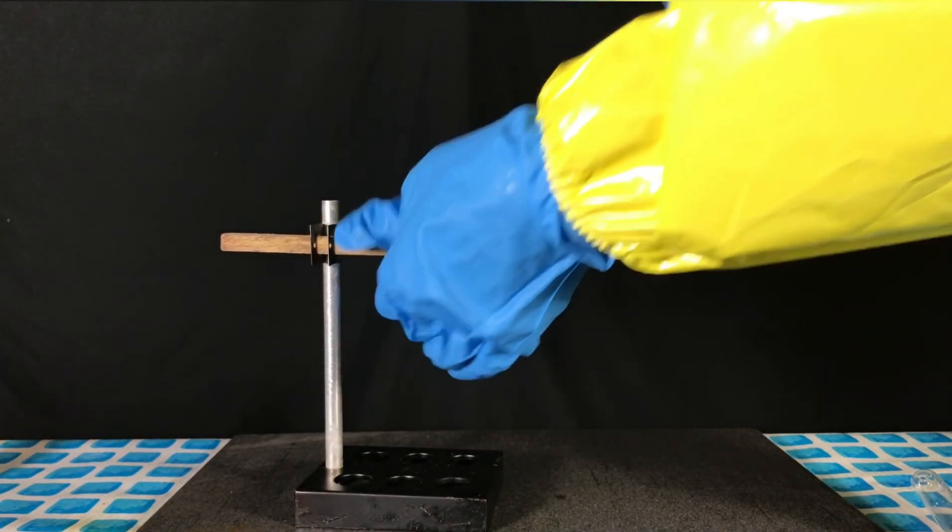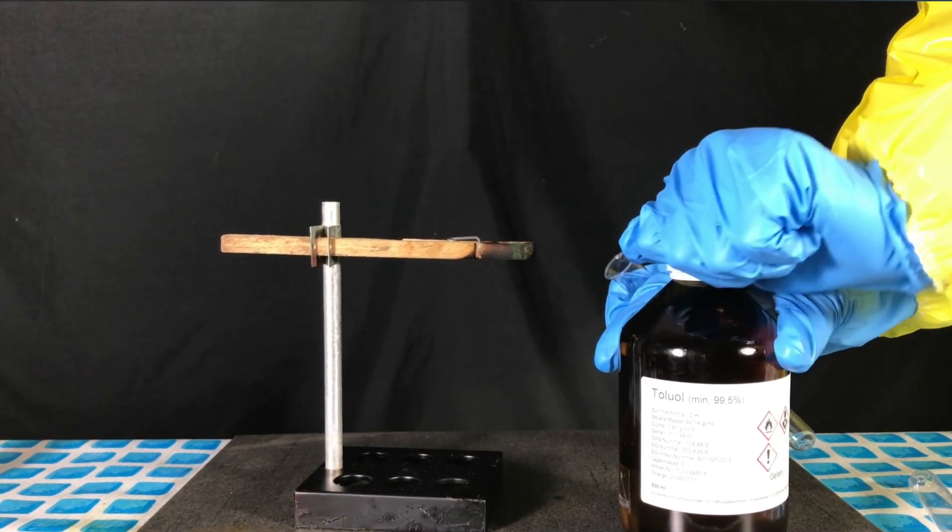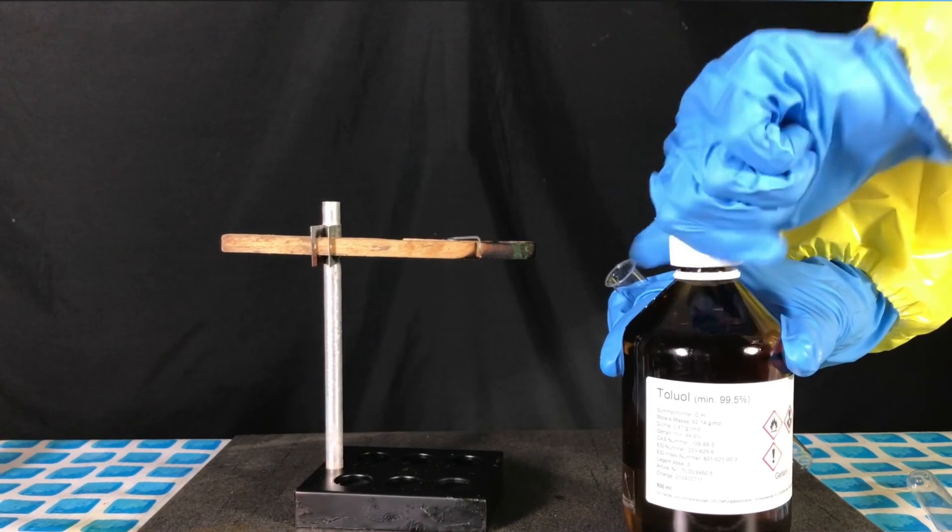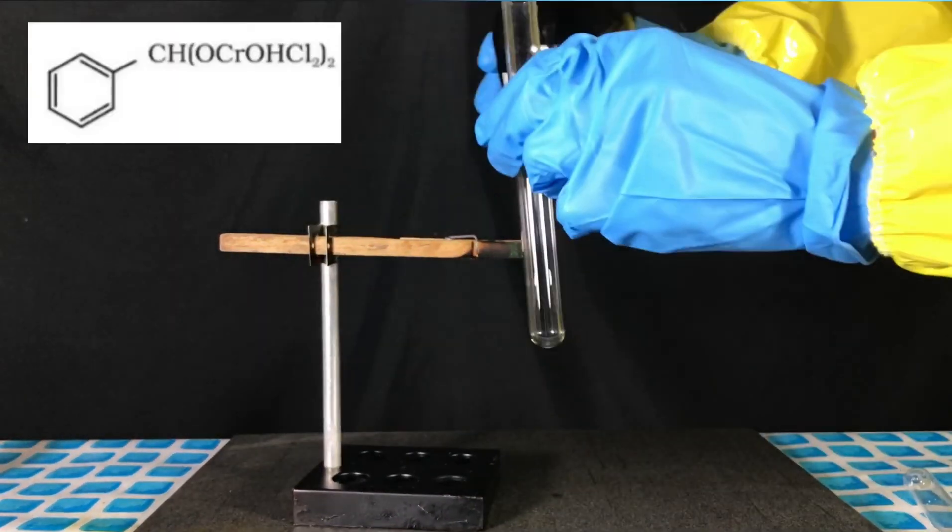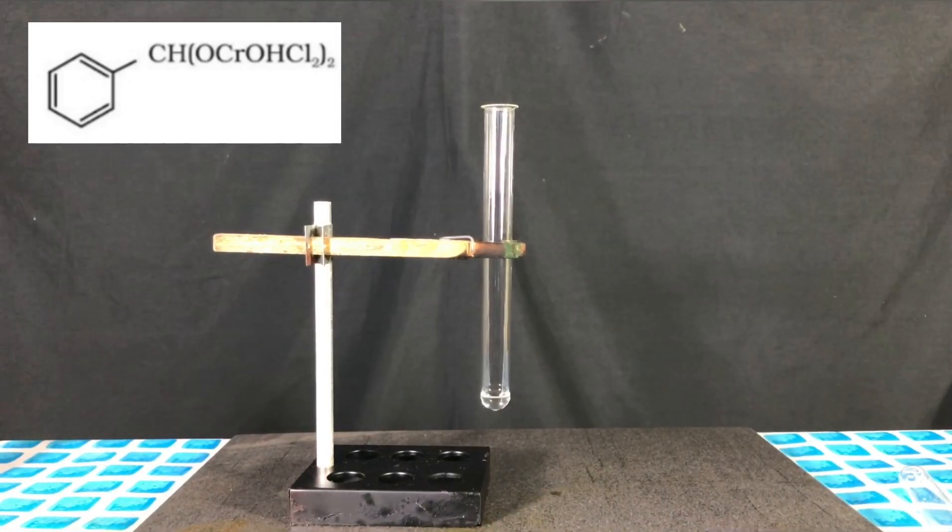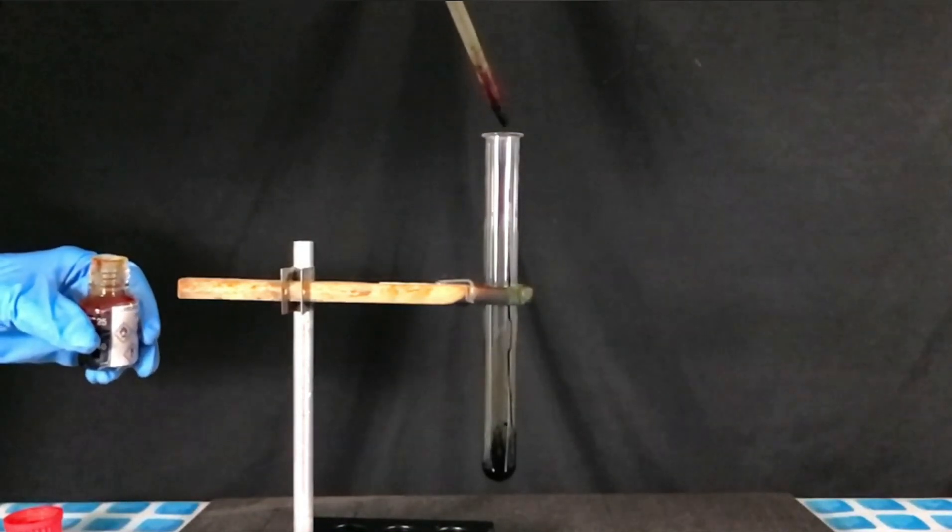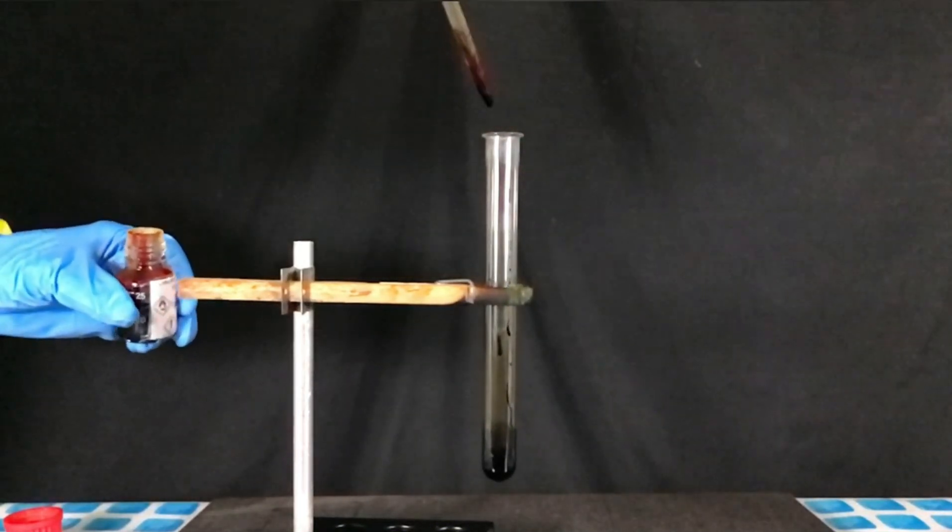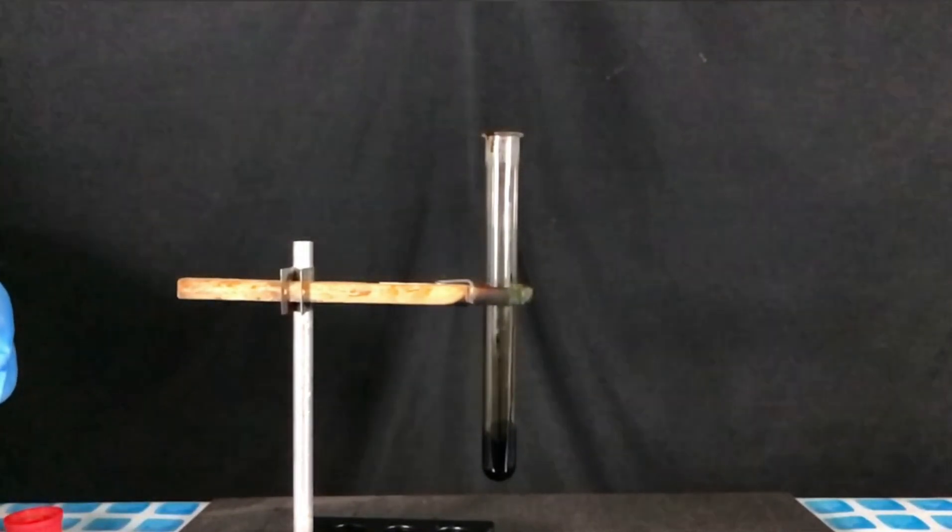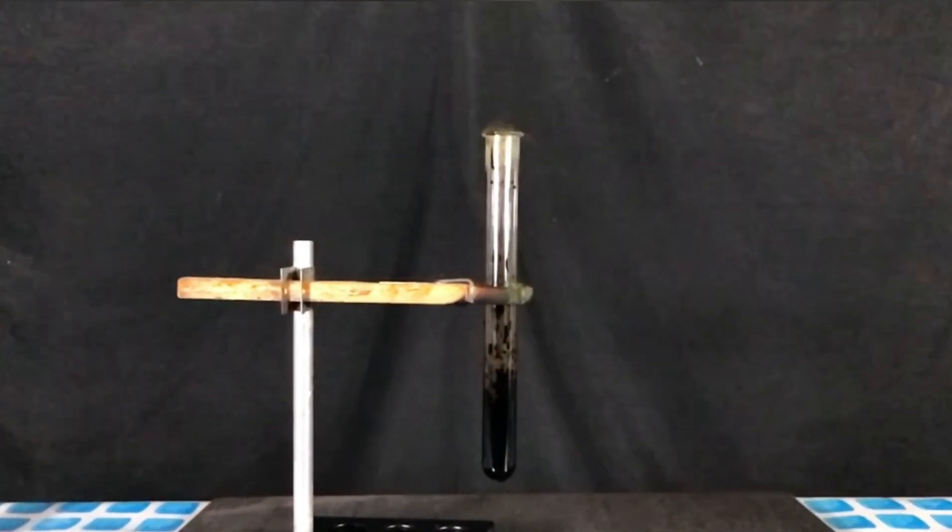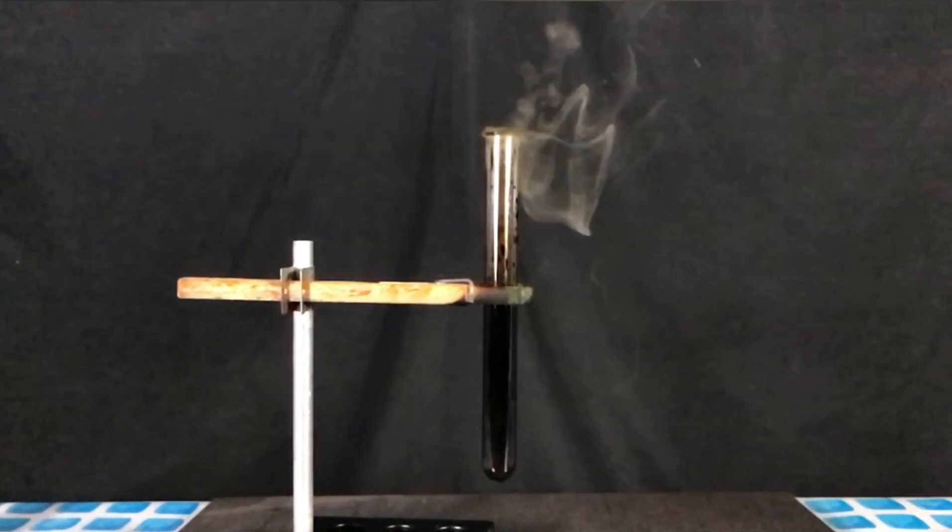Now even more interesting stuff. Let's try some toluene. What's interesting is that toluene can be directly oxidized to benzaldehyde using chromyl chloride. Chromyl chloride first reacts with toluene to form a complex which can then be hydrolyzed to form benzaldehyde. This is what the chromyl chloride toluene complex looks like. The chromyl chloride was added and nothing happened. I let it sit like this and it didn't look like anything would happen anymore. And then I switched off the camera. Approximately 30 seconds after I switched off the camera it began to make a hissing sound and I switched it on again.